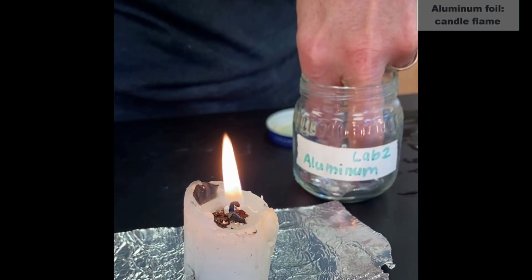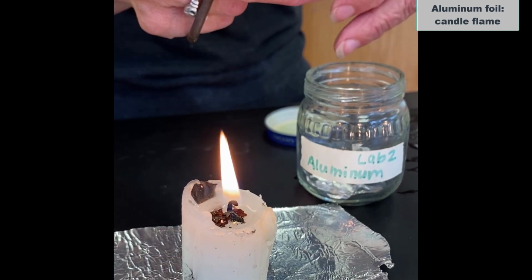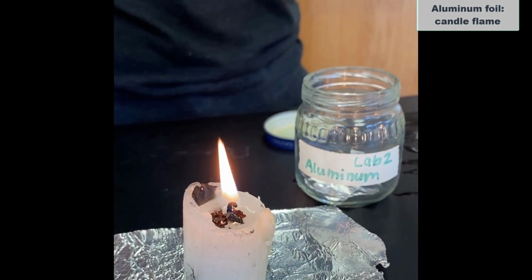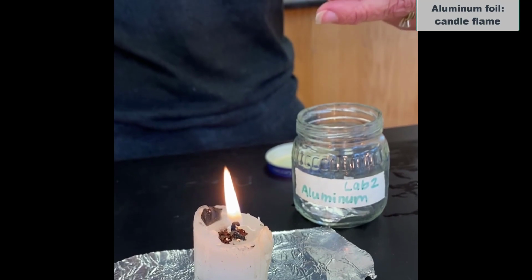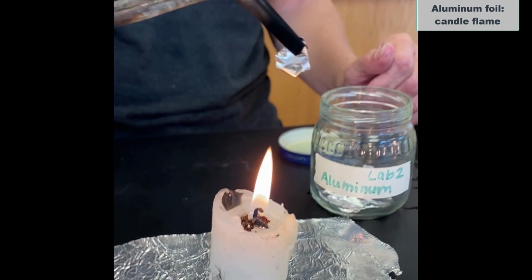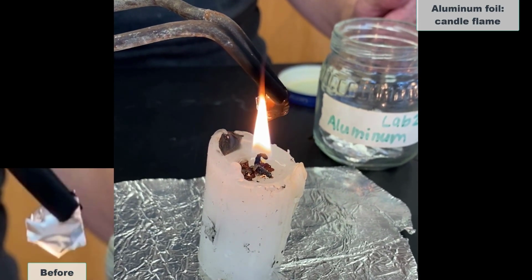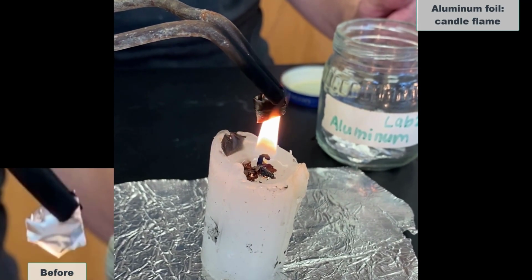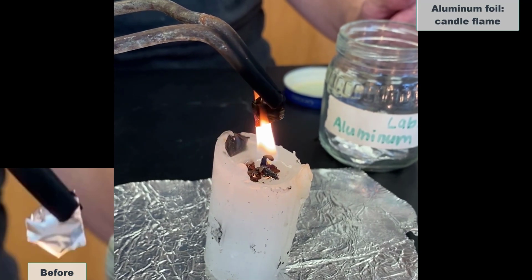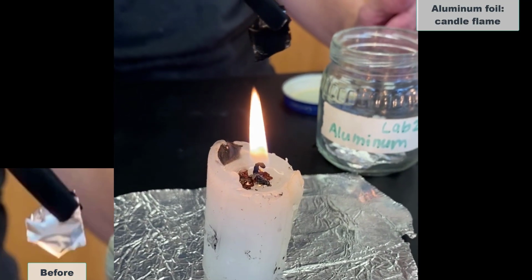Now we're going to try aluminum. And this is actual aluminum foil, made of actual aluminum. And there it is before. And if I go into the candle flame, and there is after.